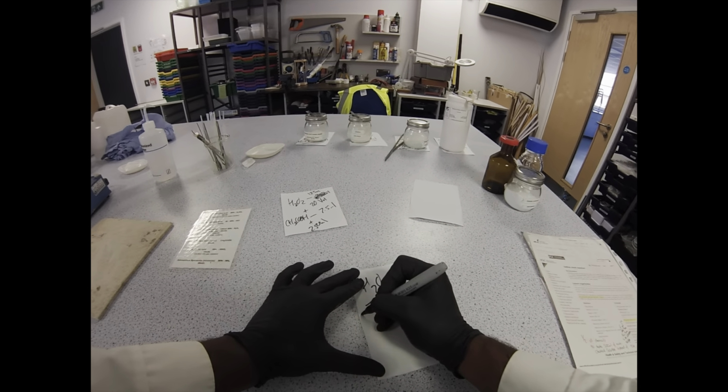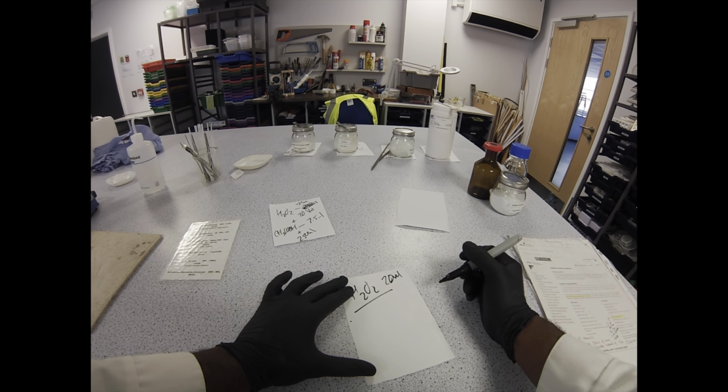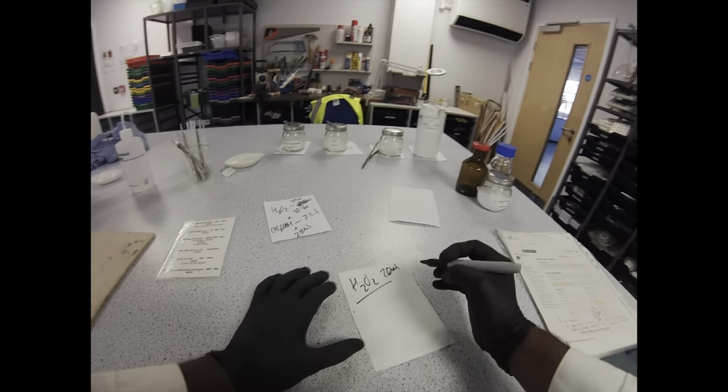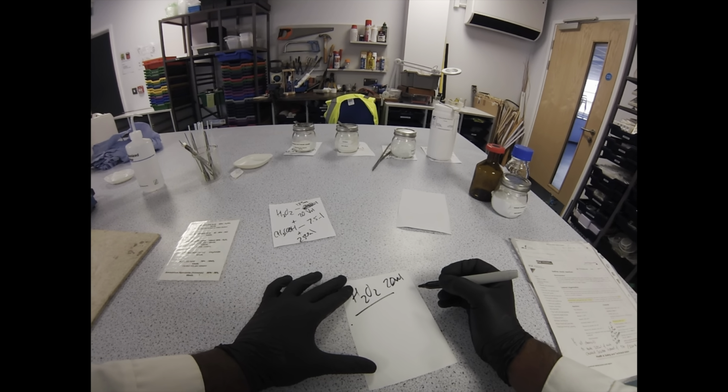Working this dilution is going to be slightly more annoying because the original protocol called for 500 ml of 20 vol peroxide and then 30 ml of acetic acid, and we need to adjust the volumes, but we need to keep the concentration the same.